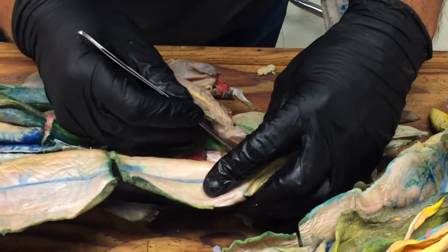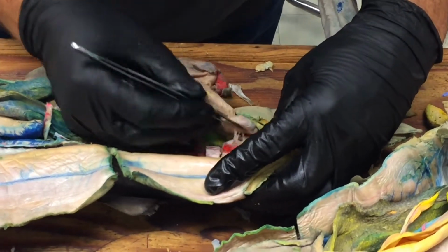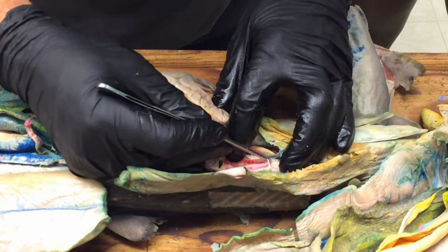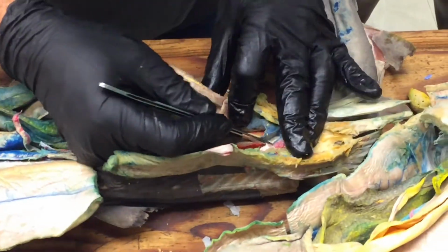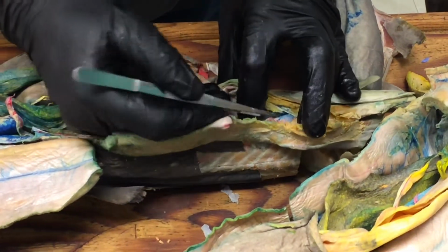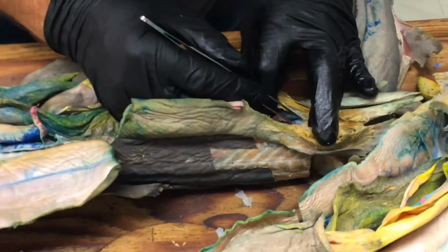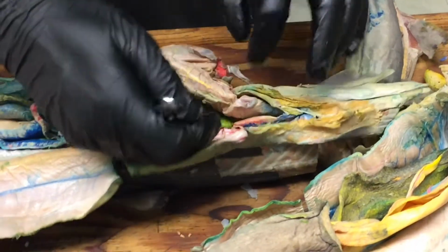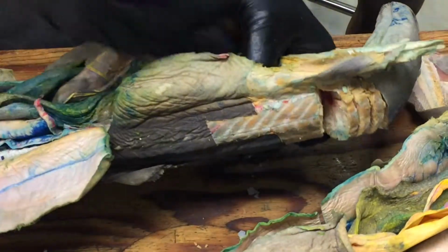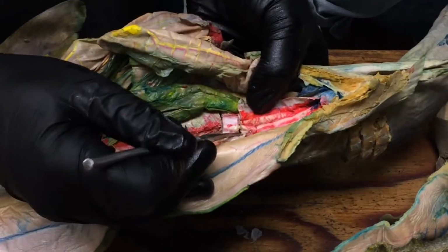I'll save you another side that I haven't destroyed. Let's do that right here. And this large sac is called the seminal vesicle. Okay, and let's see if I keep going. There we go. Just want to make sure we can really see these things. Jack is being very nice as I destroy his shark. Okay. So what you'll see is at the back end here, there's a big sac. This is the seminal vesicle here.